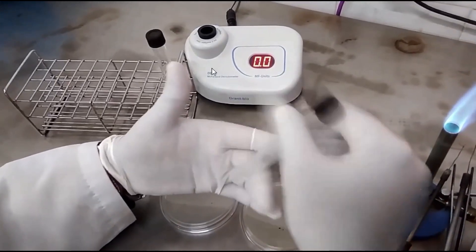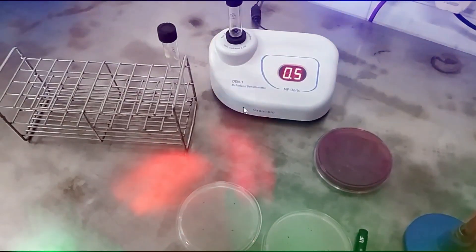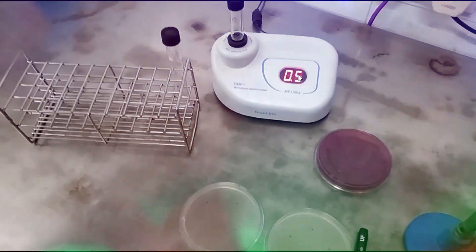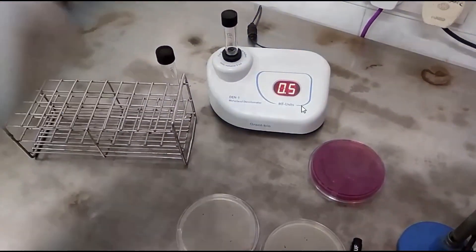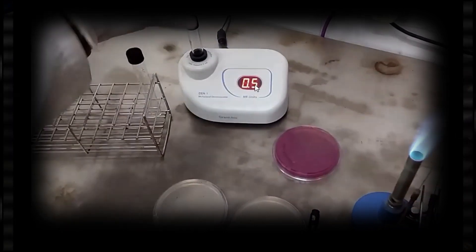Now measure density. Here you can see 0.5 McFarland concentration standard that we need.